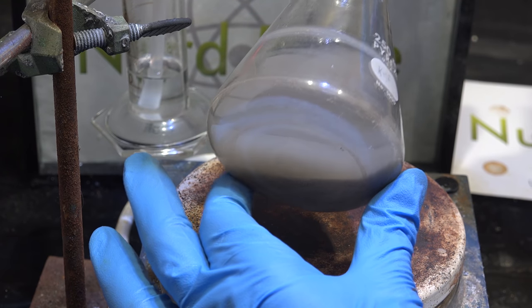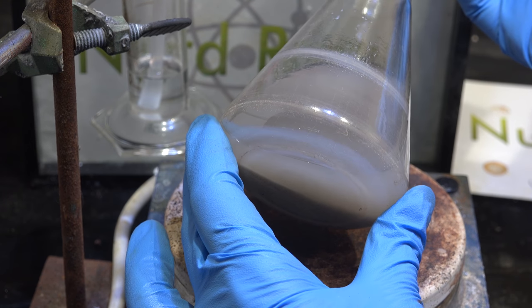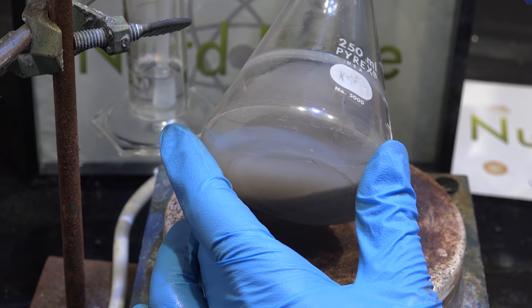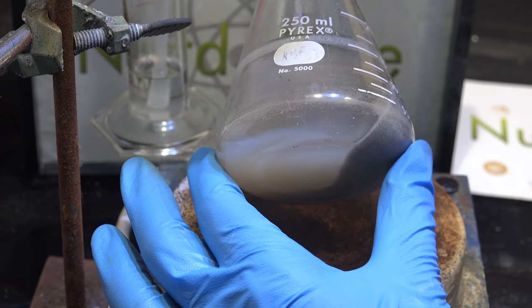And here we are at room temperature, this is not good. This white clouding of the glass definitely wasn't there when we started and indicates the glass is being damaged. This particular experiment is a failure.